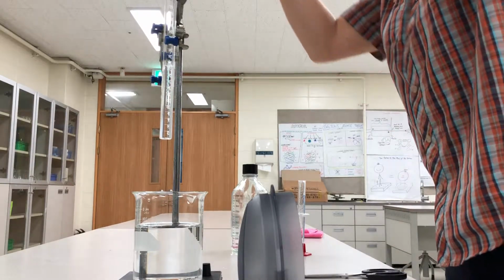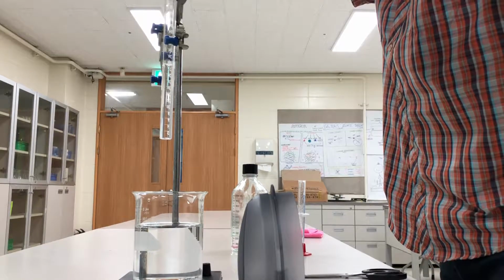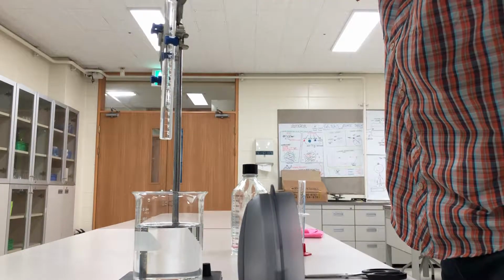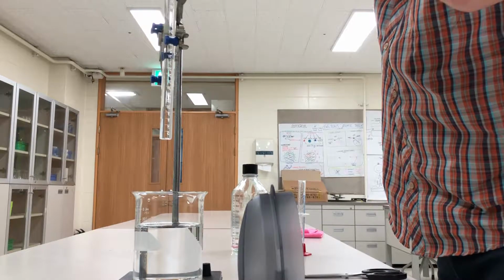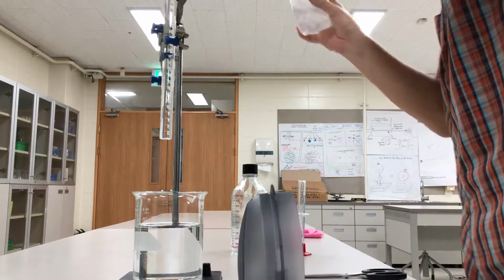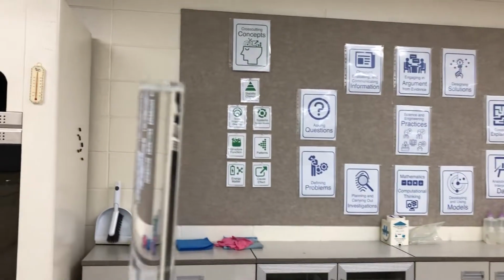and then once I've got a sufficient amount of water in, I'm just going to go ahead and fill it on up. And I'm doing this fast just so that it doesn't take 30 minutes for you to watch this. Okay, and I'm going to fill it literally all the way to the top. And the goal is to make sure that there is no air up here.